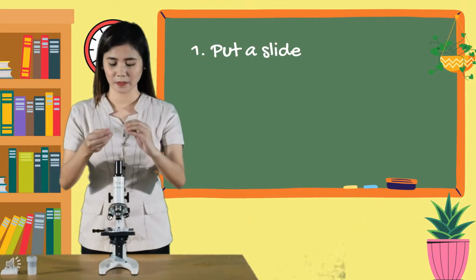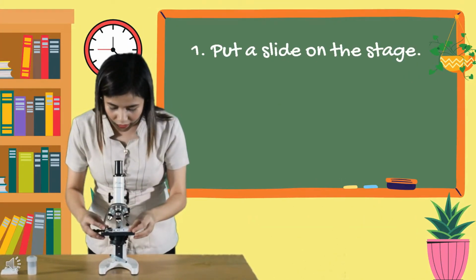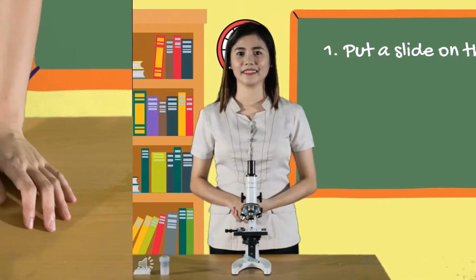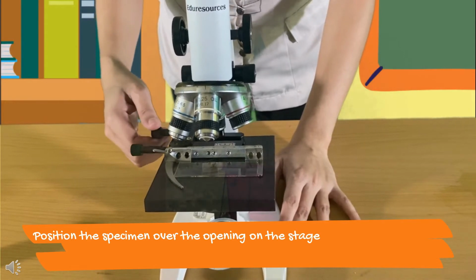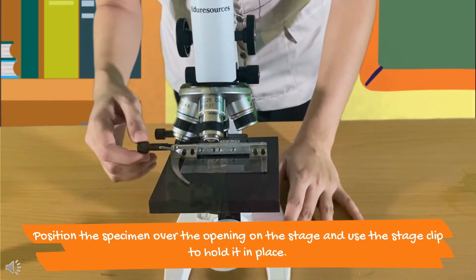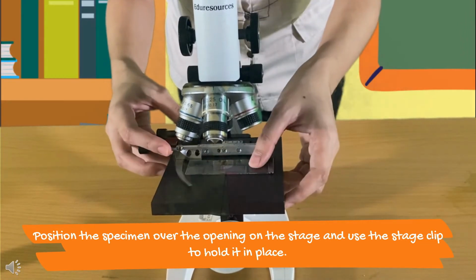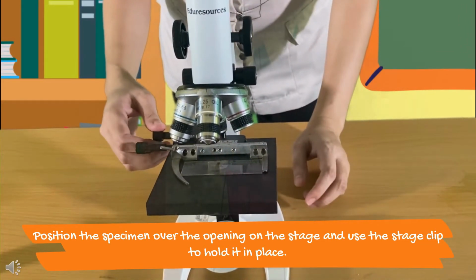Here are the steps to follow when examining a specimen under the microscope. First, put the slide on the stage. Position the specimen over the opening on the stage and use the stage clip to hold it in place.